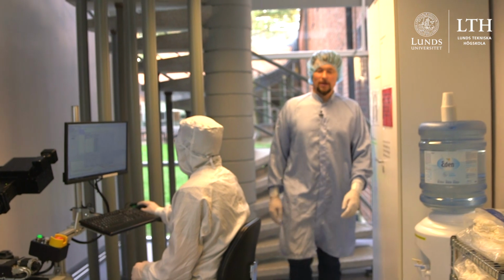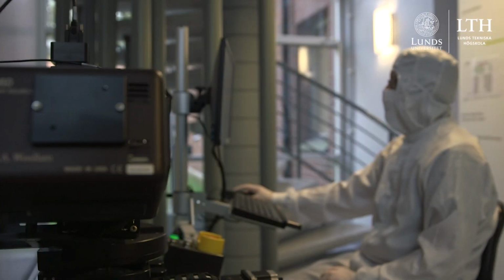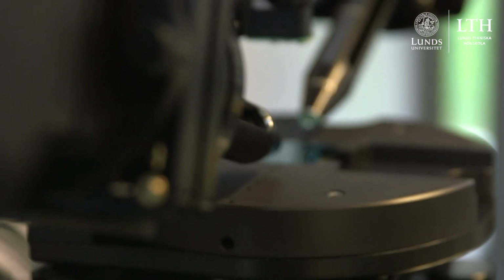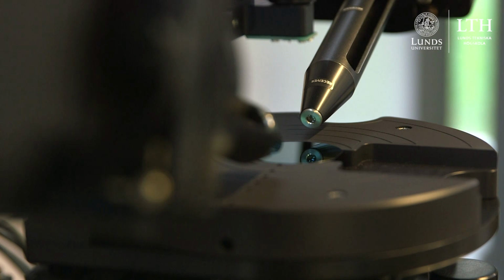Okay, so when you've made thin film deposition or done an etching process, you might want to measure some of the properties of the sample. And with this equipment here you can measure the thickness of a film, and with the equipment behind you can measure the surface roughness using profilometry.